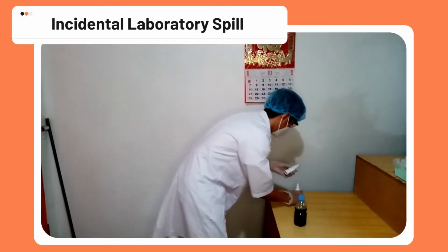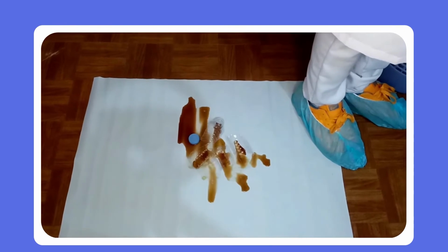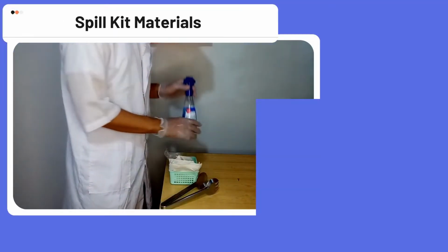In the medical technology laboratory, you and your laboratory workers should be prepared to respond to incidental chemical spills. These are spills that are small in scale and may be cleaned up without any dangerous respiratory exposure. In order to clean up spills, the materials are found in a spill kit.